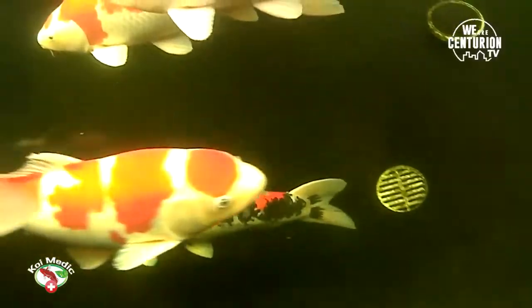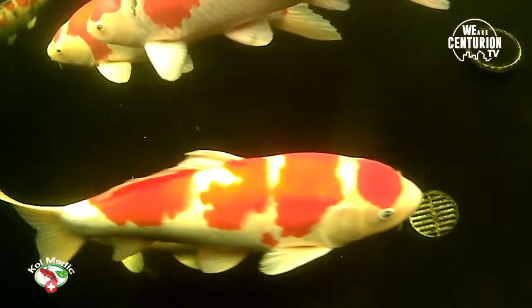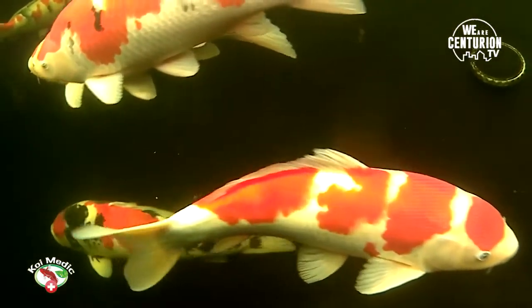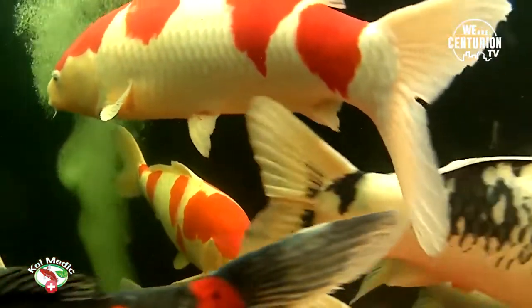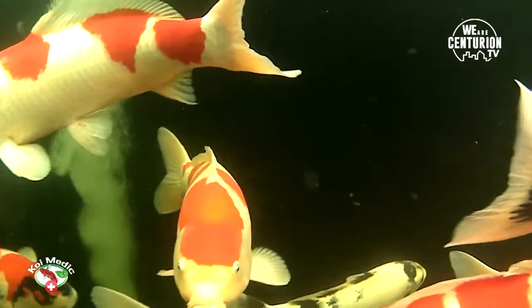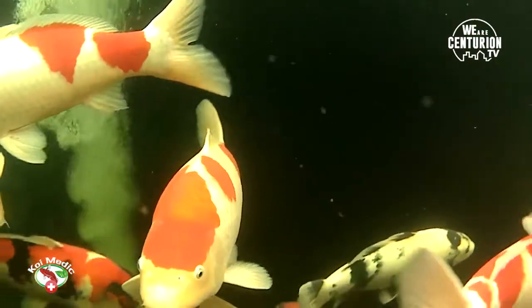Hi everybody and welcome to Episode 3. As we said, we're going to do microscope analysis and then we're going to have a look at some parasites and understand what parasites do. This is living water, so there are naturally those elements in there, but how do we control it in our koi pond?